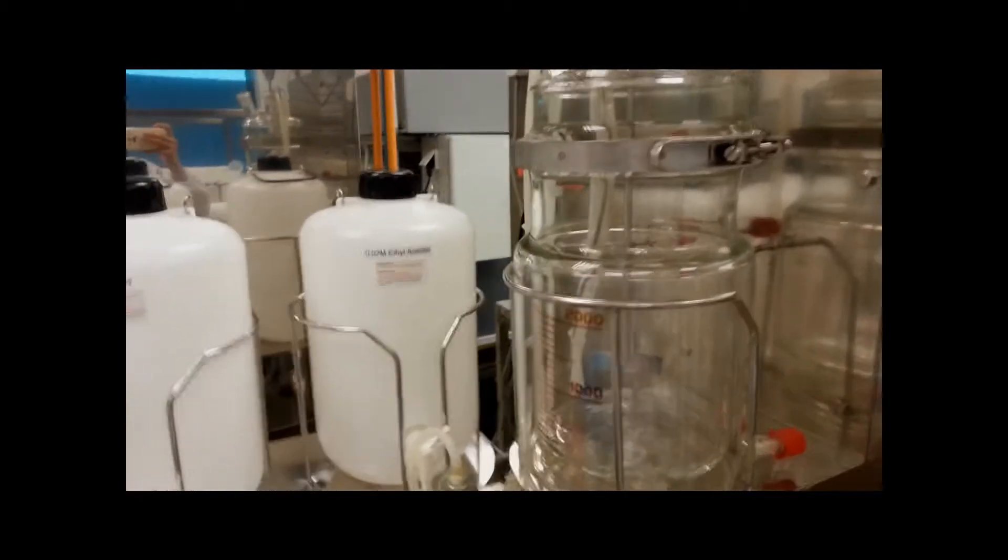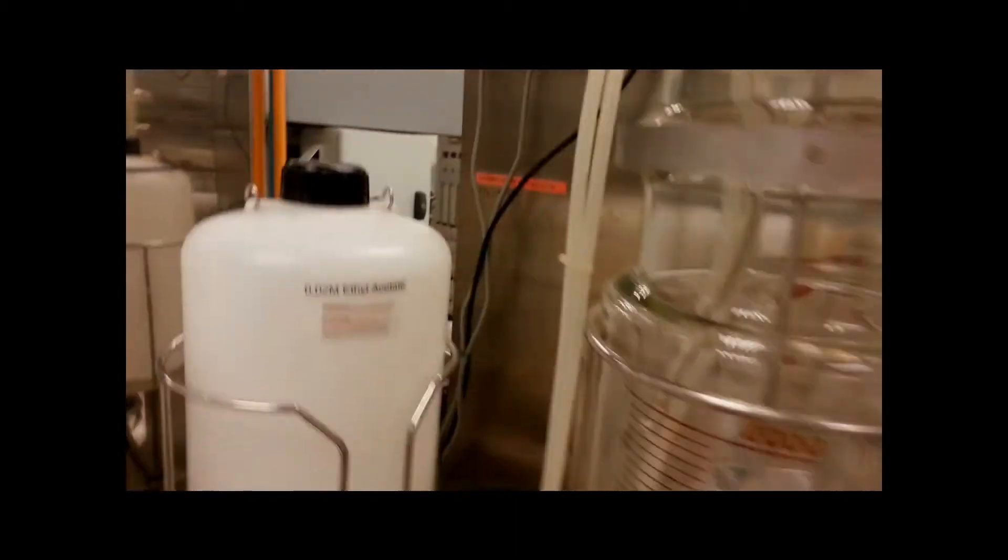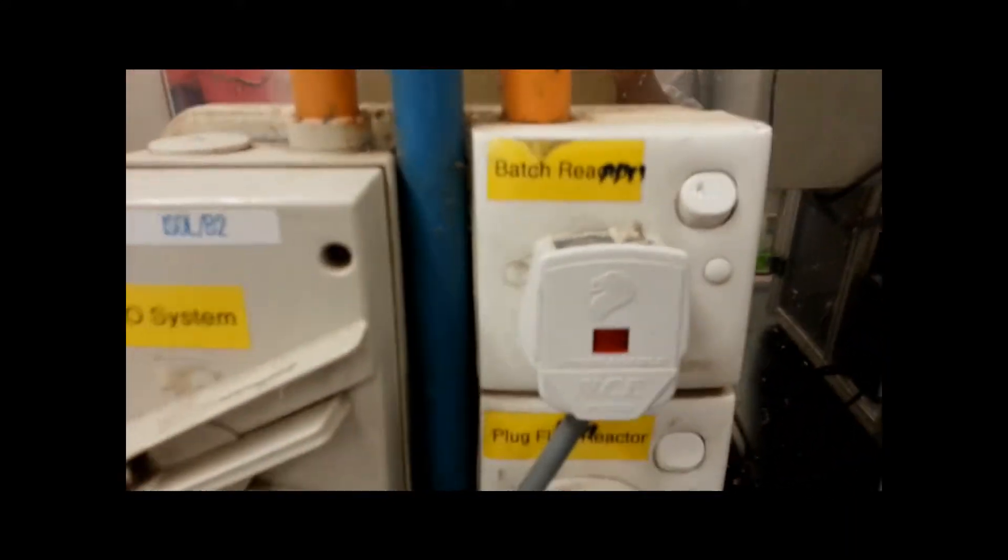After the 10-minute mark, you will be required to turn off the stirrer followed by the power supply for the 3 switches and the main power supply which is located around here, the batch reactor.